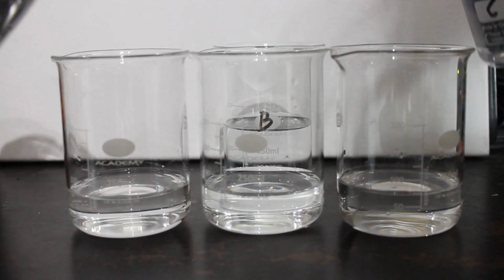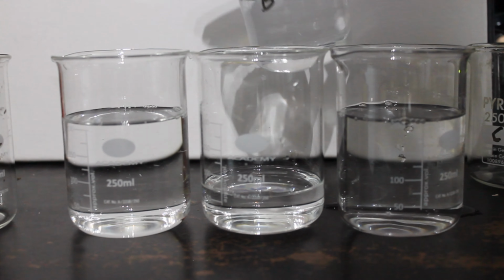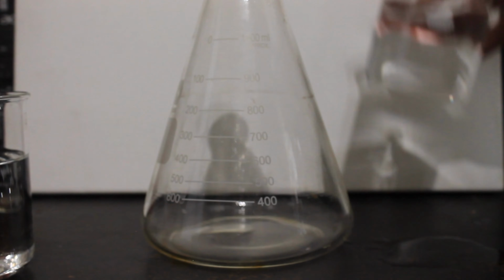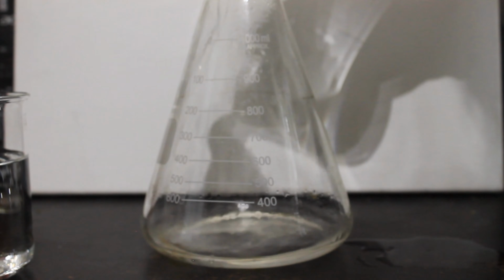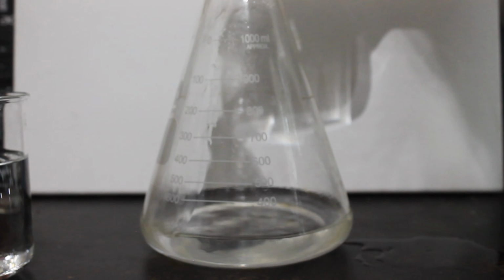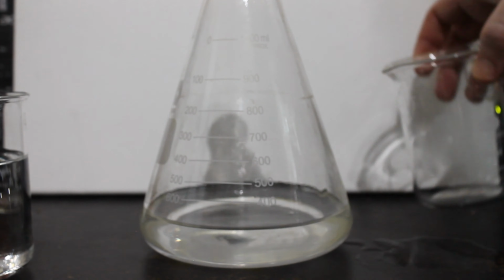So in a panic, I added more. Nothing happened. In a final panic, I then put everything into one large flask in the hopes that anything at all of interest would happen with this. Once again, nothing.